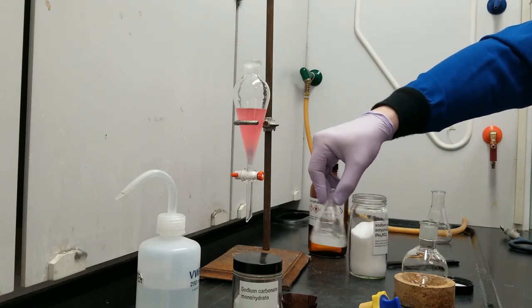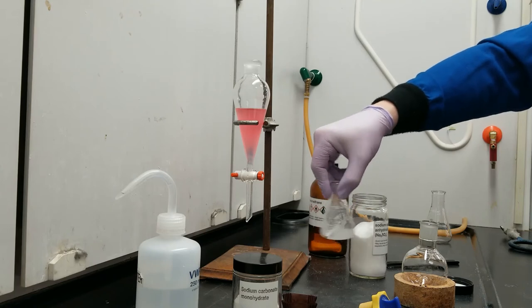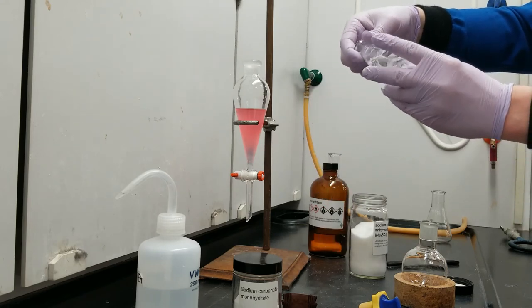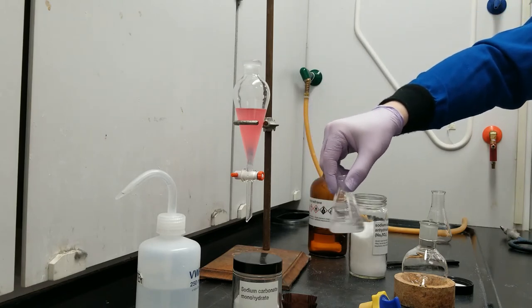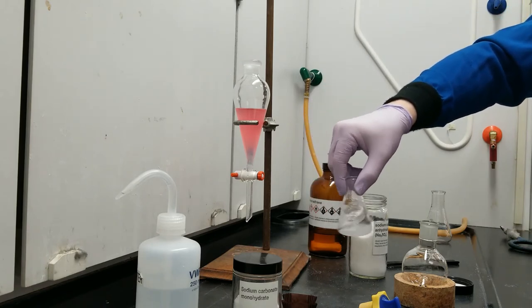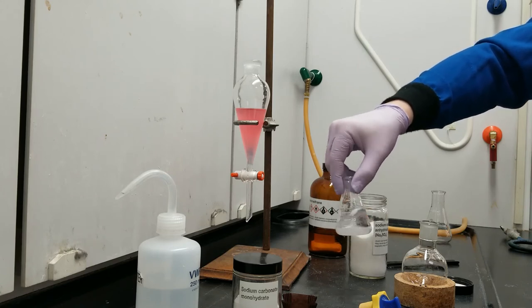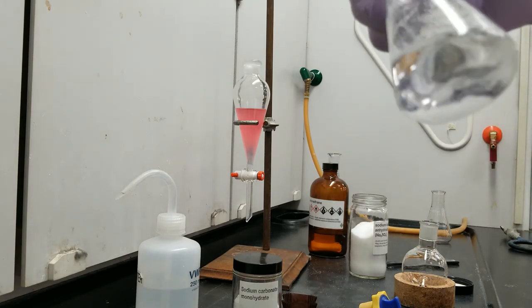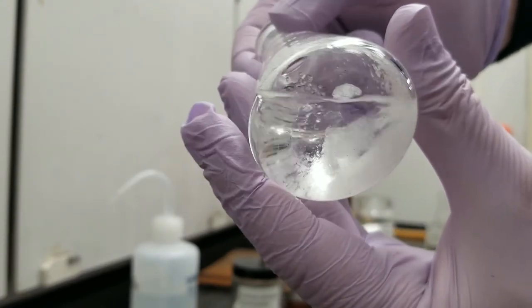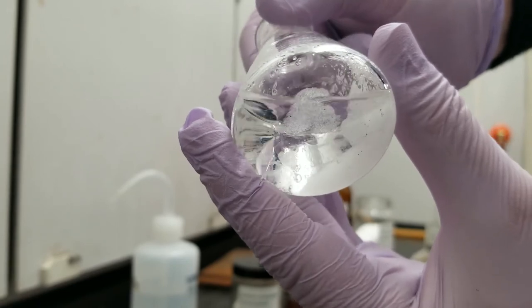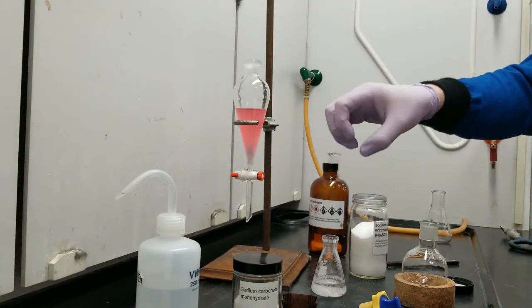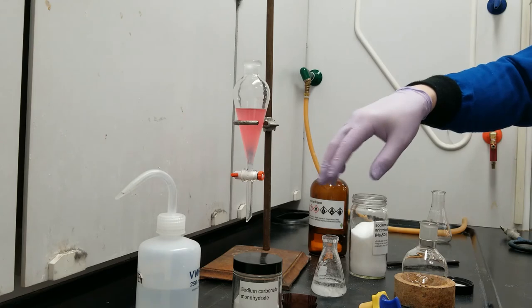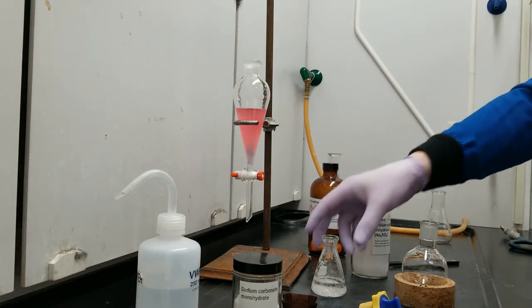Once I put some sodium sulfate in and it has no effect and it doesn't turn sticky, I know that all of the water has been soaked up and reacted with by other sodium sulfate. And the DCM has been dried thoroughly. And I always tell students that if you're ever unsure, if you think you're there but you're not sure, it never hurts to just let it sit for two or three minutes. The stuff that's stuck to the sides of the glass, that's never going to become less sticky. The stuff that found water, found water, but the new stuff is nice and free flowing so I can continue.